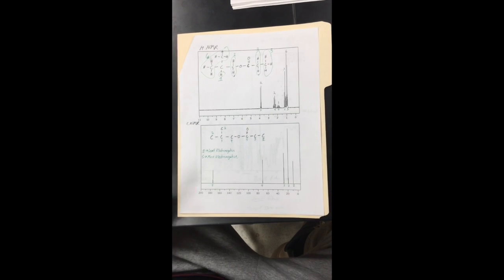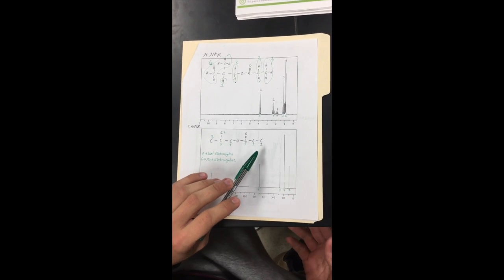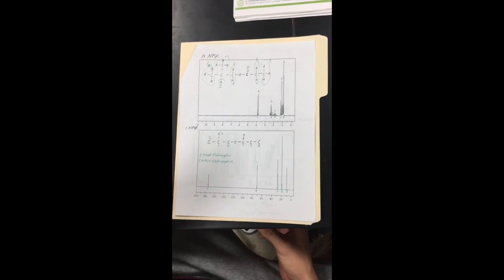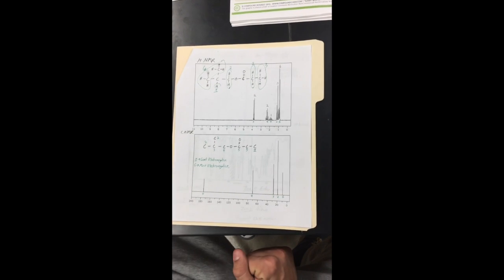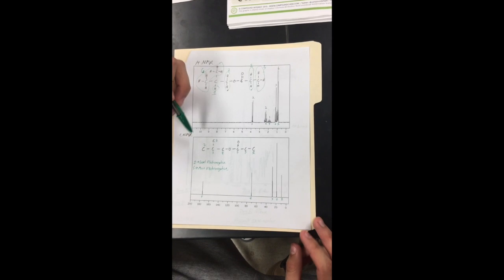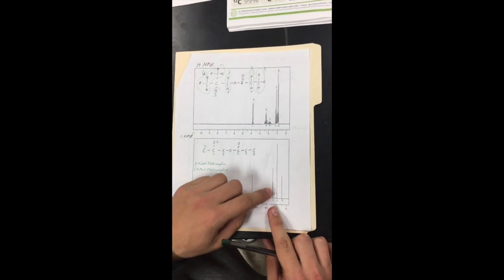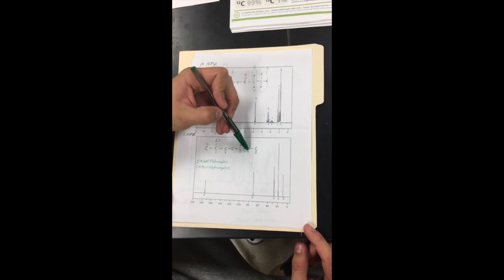On carbon NMR, we're going to look at all the carbons in the molecule. So first off, we're starting with the least electronegative, which is 1, and it's right here, and we found it to be a primary alkyl, so that's why we circled here. 2, since it's so tall, we thought it would suggest 2 carbons in the molecule, and it also showed a primary alkyl, so we labeled it the 2 here, which would have hydrogens coming off there. Next, the 3, the line is thick here, which also suggests that this line represents 2 carbons, so we had to represent this carbon here, as well as this one here.